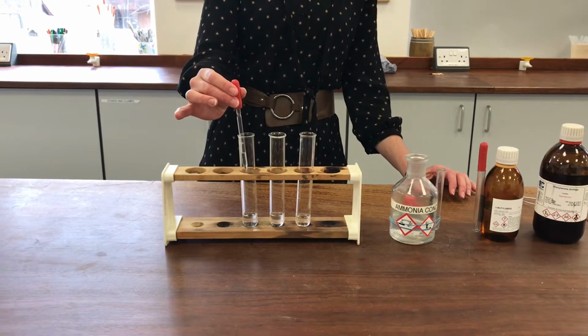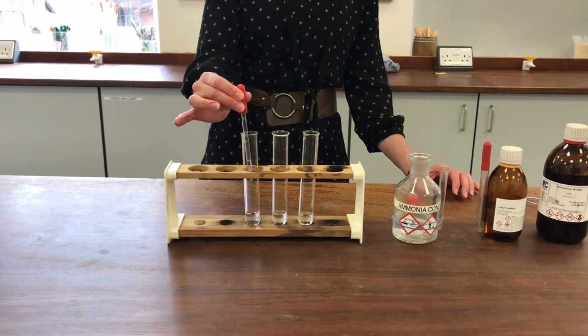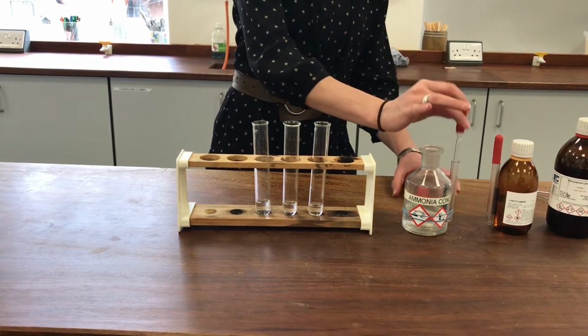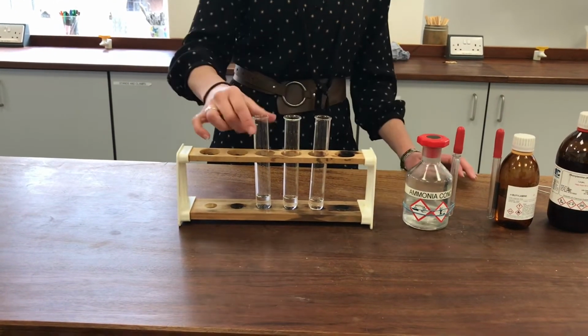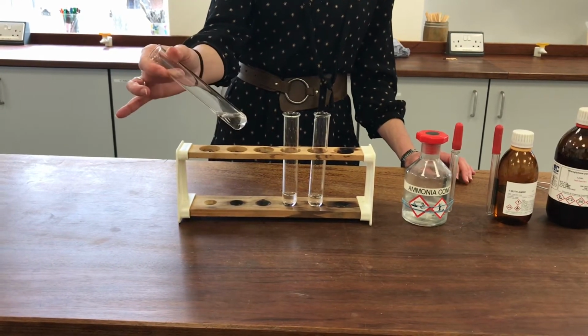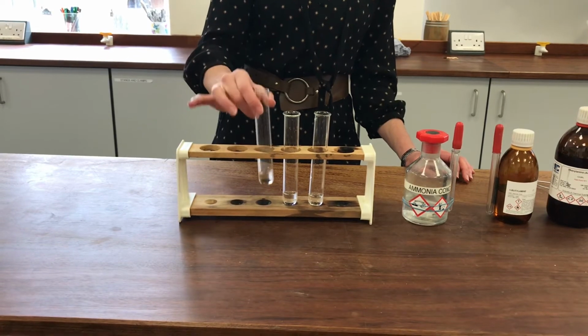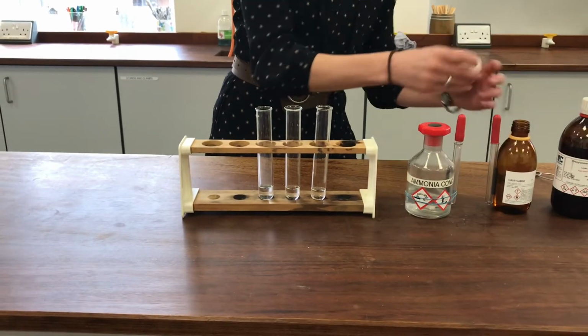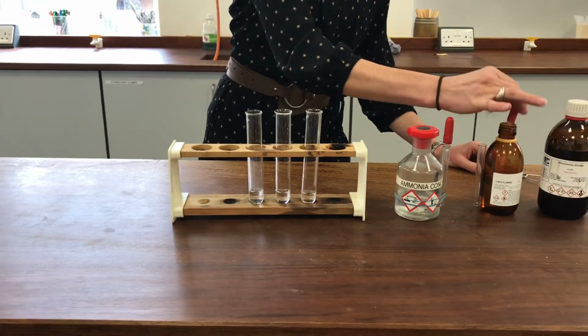So if I add some ammonia to this hydrochloric acid, it's not really much of a comparison, because to be honest, the ammonia is highly soluble in water in the first place. So you can see, well, it just looks like it's made a solution very easily. Now, the butylamine was a little bit swirly and oily looking before, so it'll be interesting to see how this one compares.